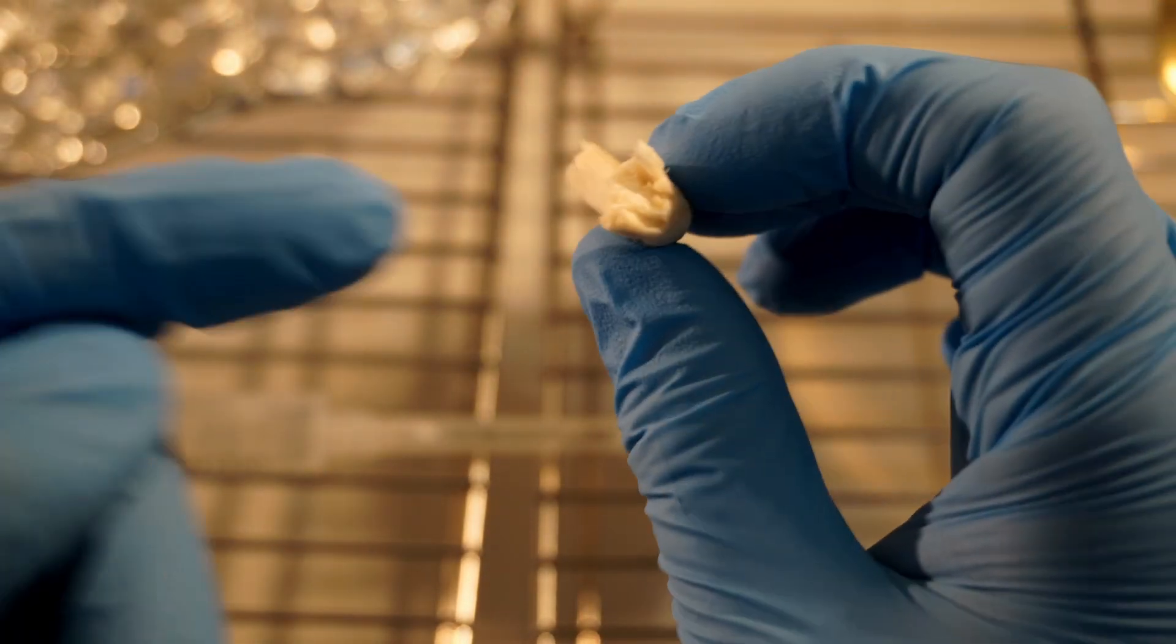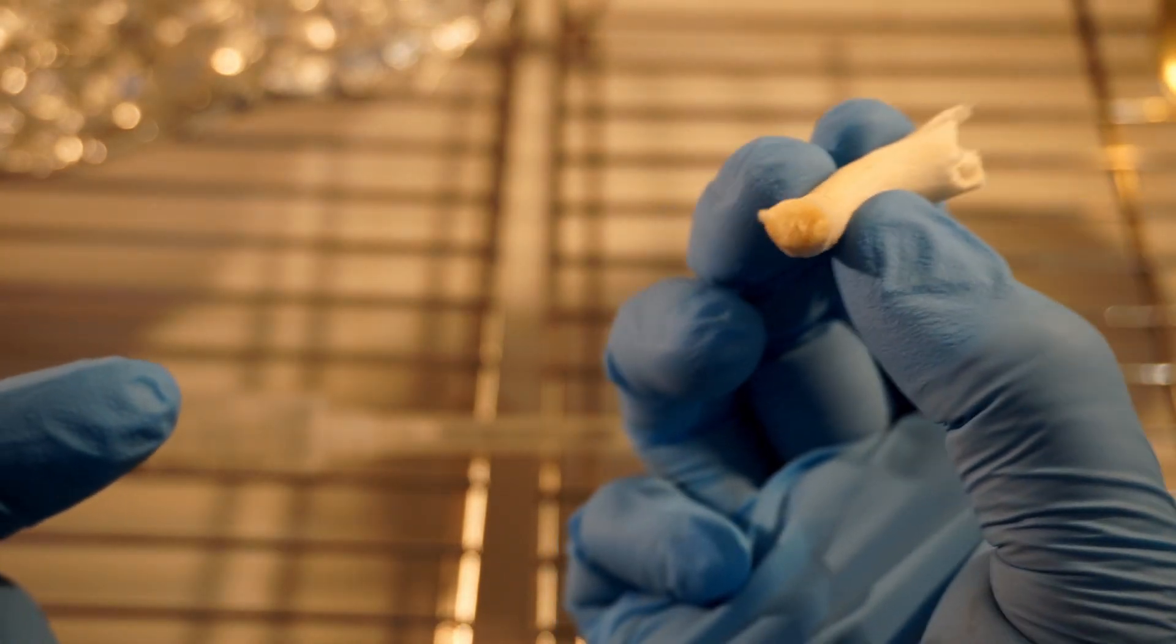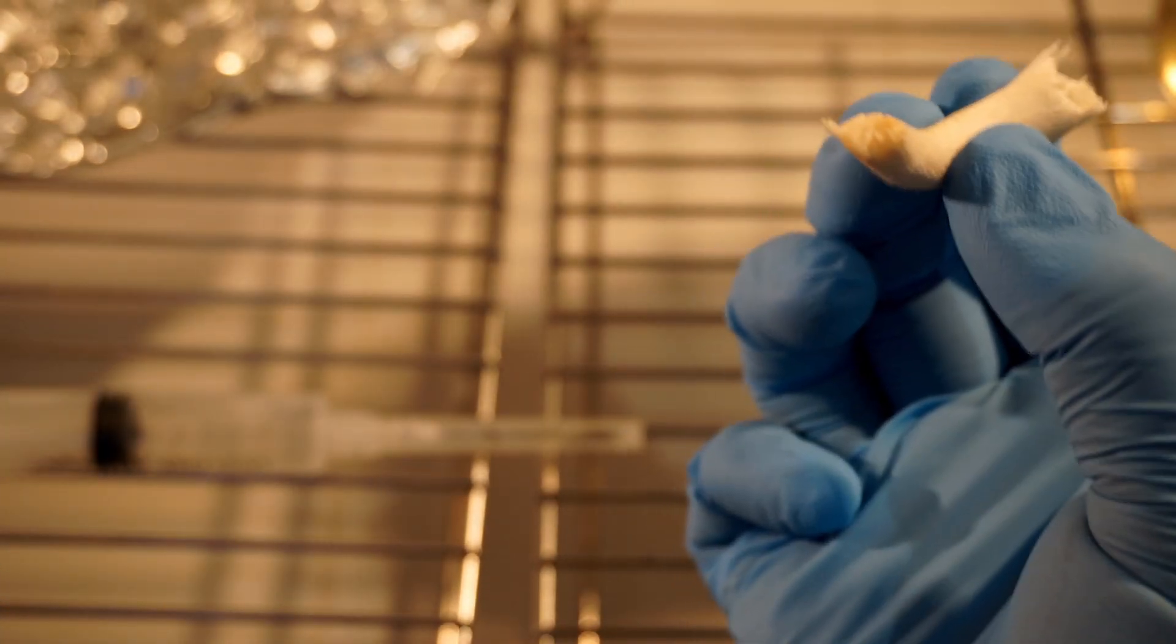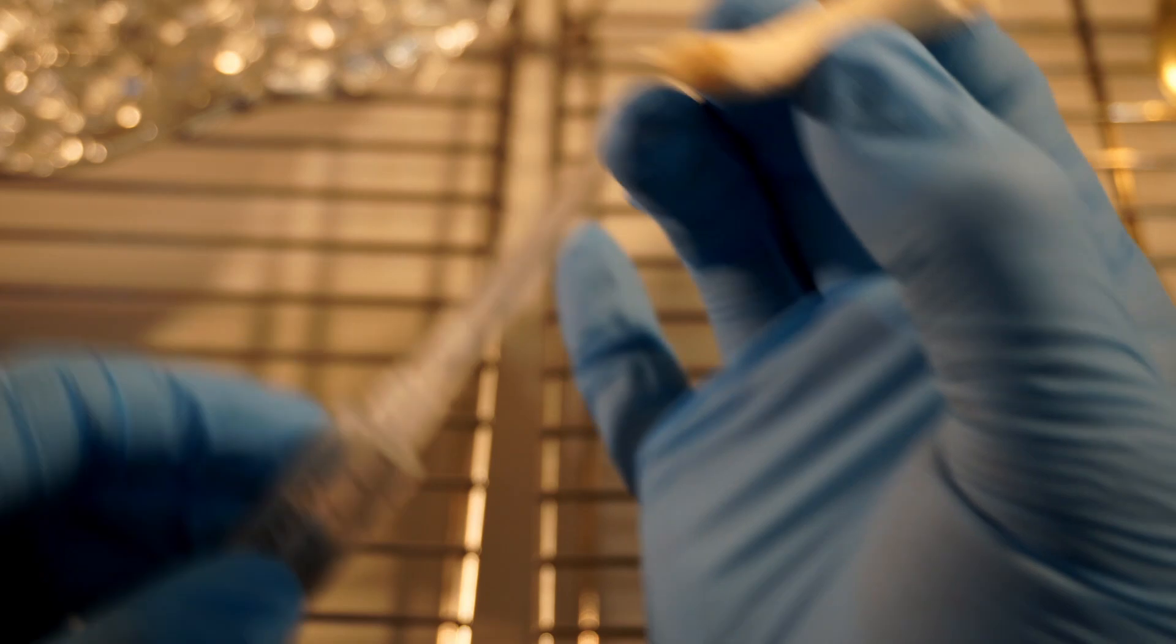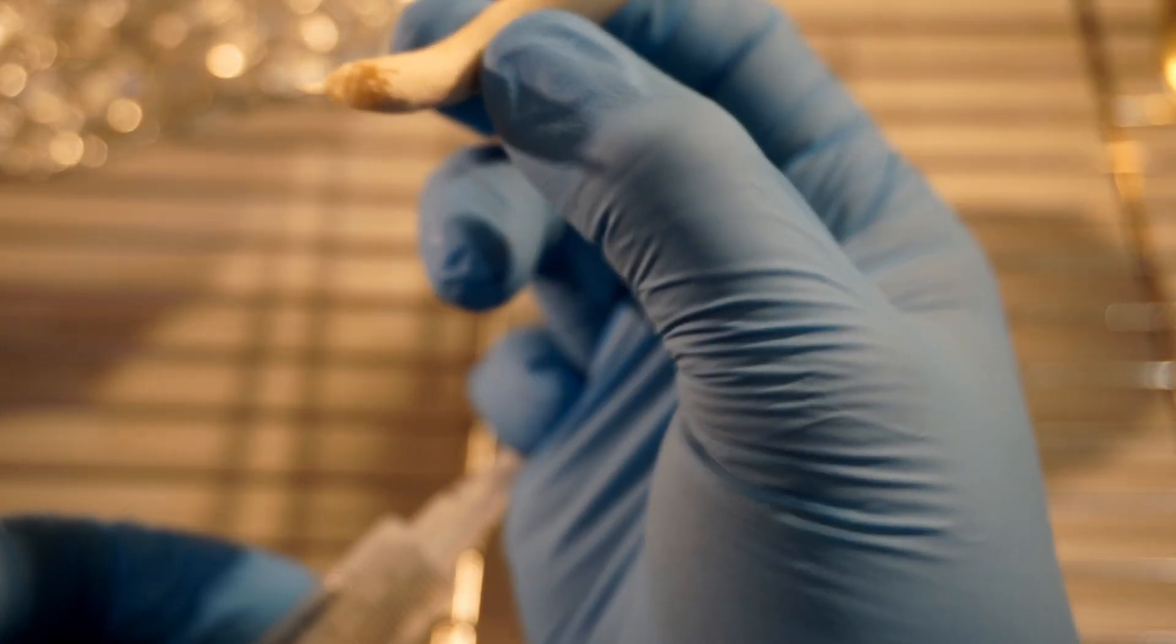You see the filaments that you can see on the inside here? These are more sterile than the outside because they haven't been exposed to the outside air until we tear it open. These filaments are where we are going to take the biopsy from.